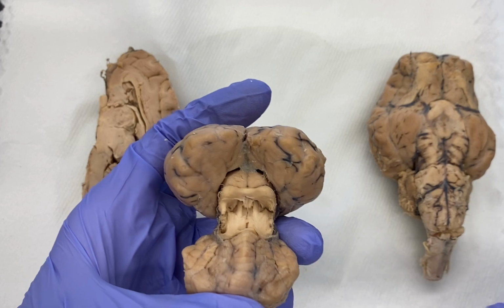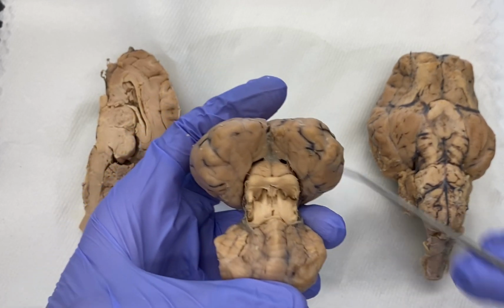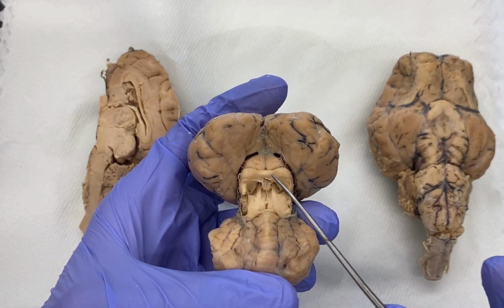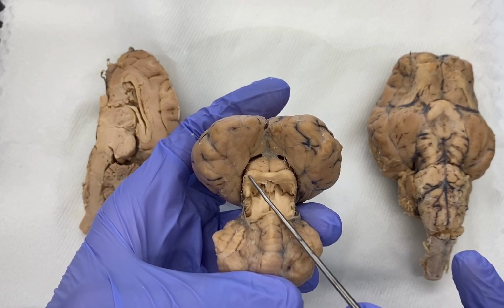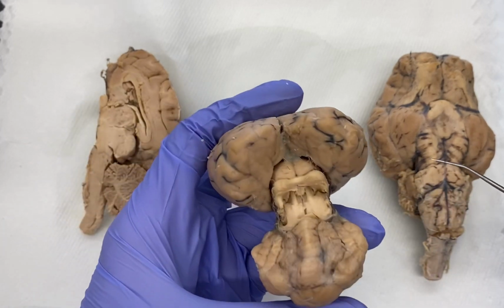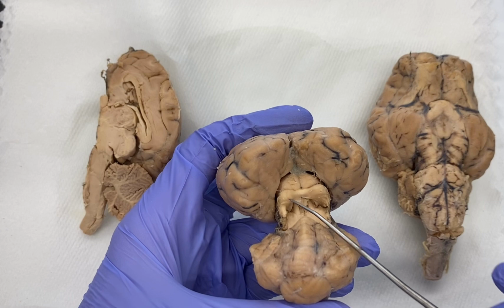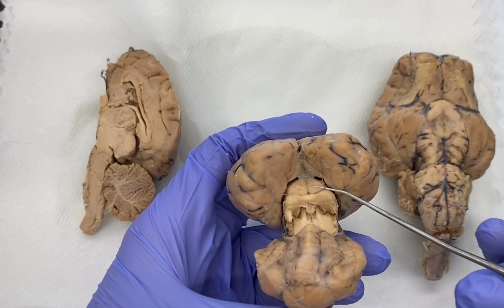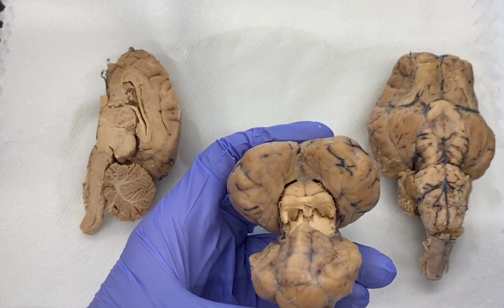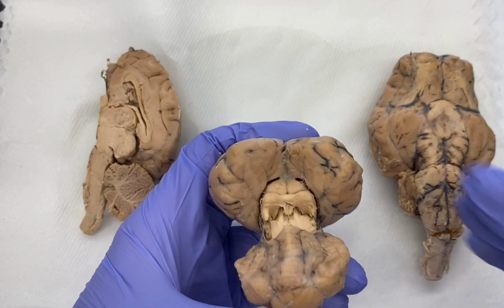What do you do? Maybe the same thing. You are startled by the horn, you turn your head, you turn your neck, you turn your eyes, you hold up your hands right before you get run over. And these inferior colliculi are helping to mediate and coordinate all that information. So sensory information coming into the brain is relayed to nuclei and neurons in these colliculi. It synapses. And then from these colliculi, you have other motor neurons, motor signals that extend out to muscles of the head and neck and the eyes and the extremities, to help mediate those movements.